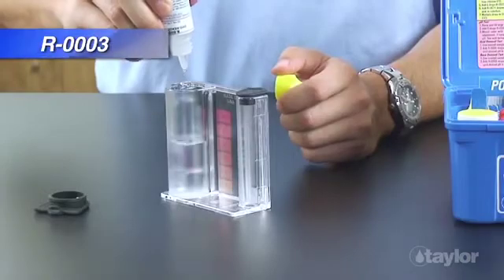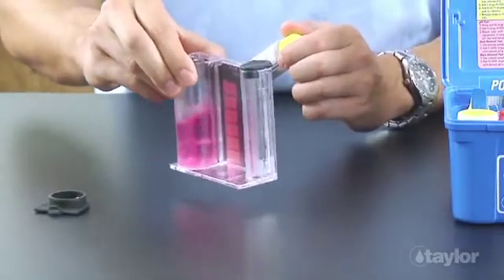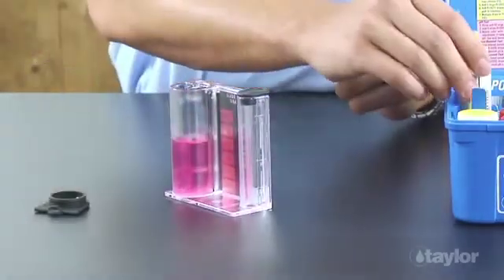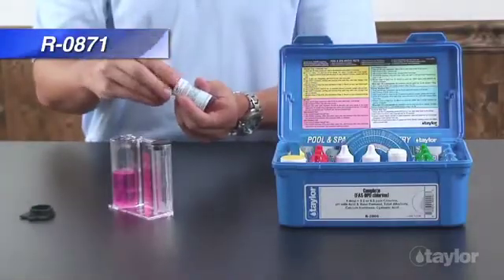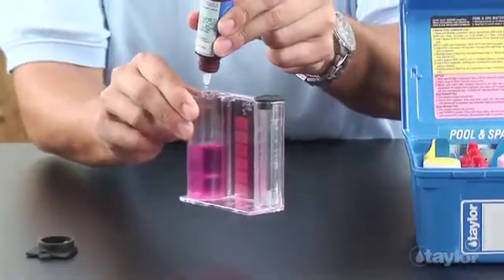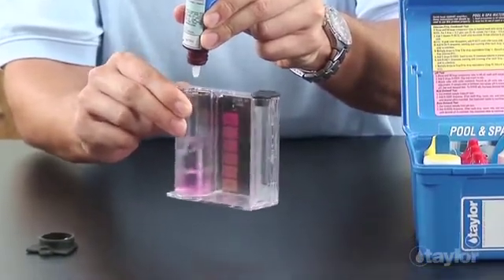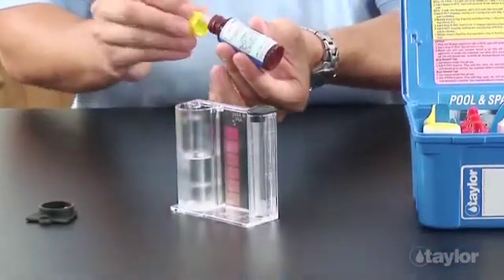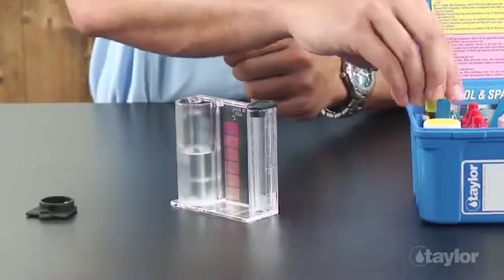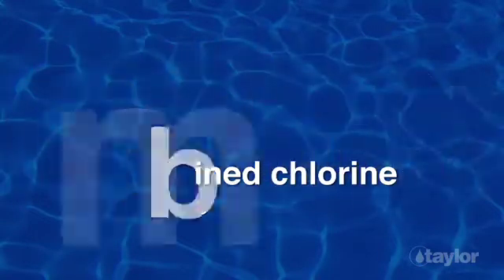Add 5 drops of reagent 3. Swirl to mix. If combined chlorine is present, the sample will turn pink. Add FAS-DPD titrating reagent for chlorine dropwise, swirling and counting after each drop until the sample goes from pink to colorless. Add 1 more drop of titrant after the endpoint to be certain the color change is permanent. If the color remains unchanged, do not count this drop. Multiply the drops expended in the previous step by 0.2 and record as parts per million combined chlorine.